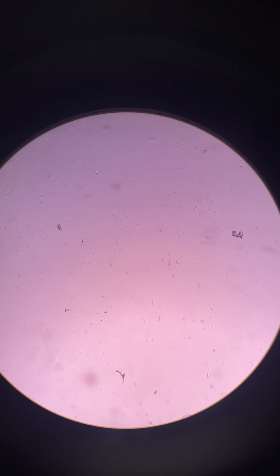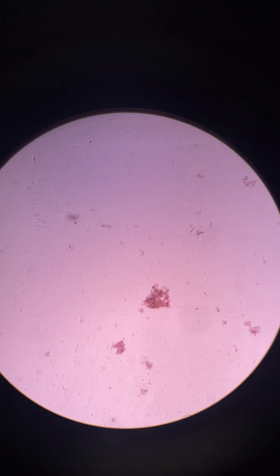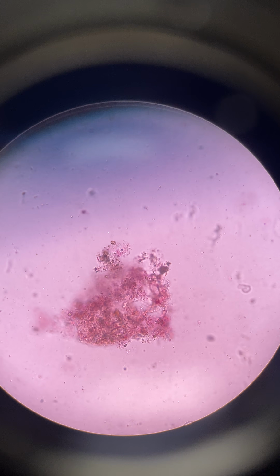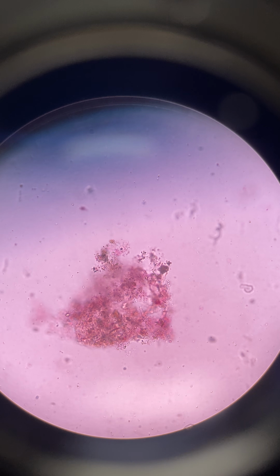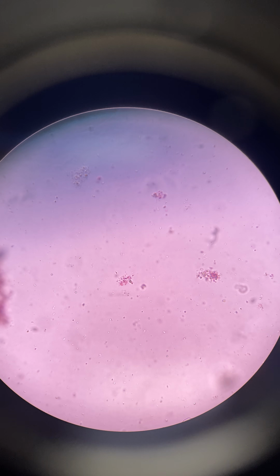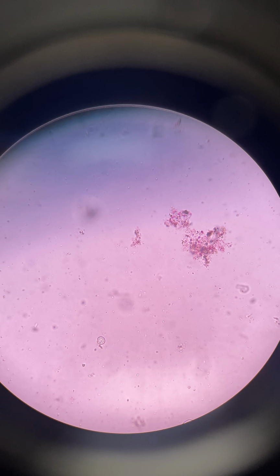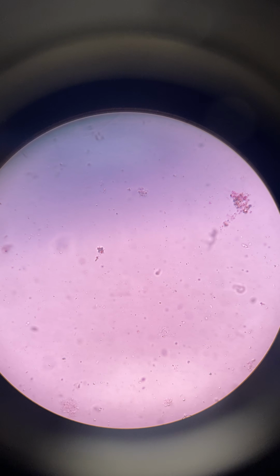All right, and there's some of those. Adjust that focus. There's some of those carmine particles, and you see some clumps and some smaller bits. And if we zoom into high power, what you'll see is the bigger clumps don't really do much of anything. They're too big to really show the Brownian motion. Some of these smaller particles here, if we watch them, we'll see them doing what we're talking about here. They're still doing the whooshing a little bit that I was just talking about.